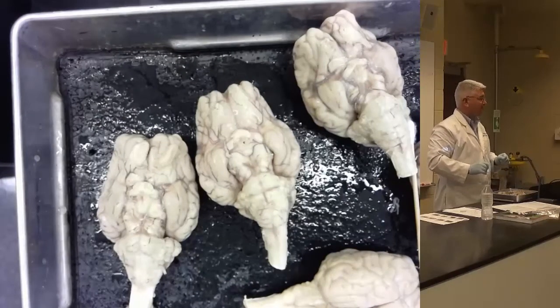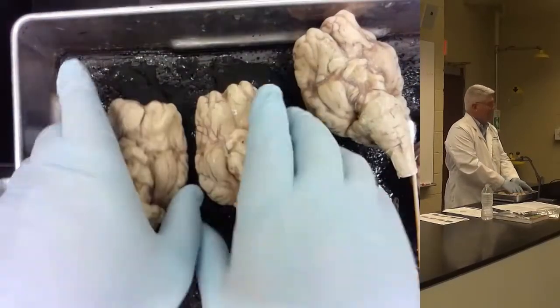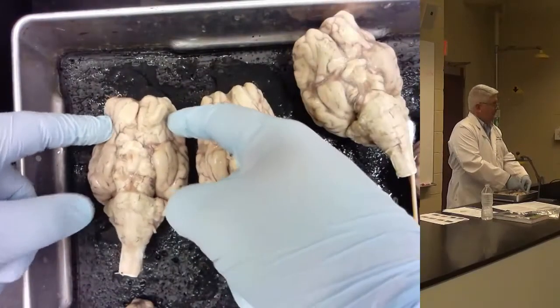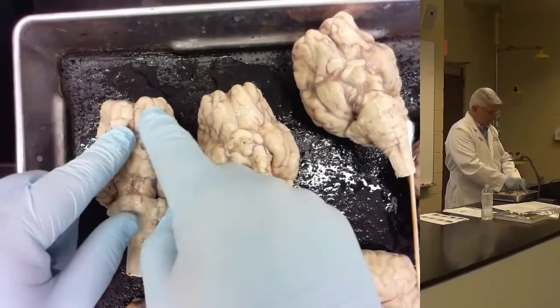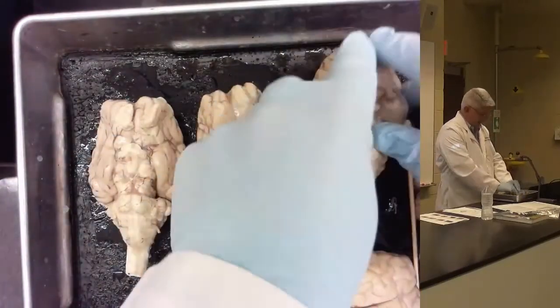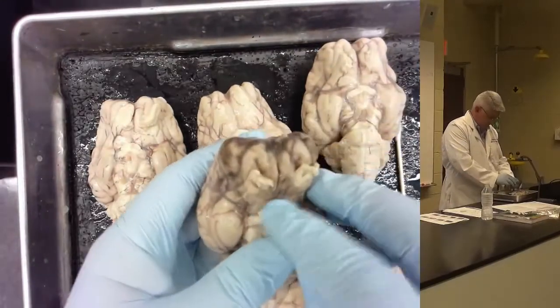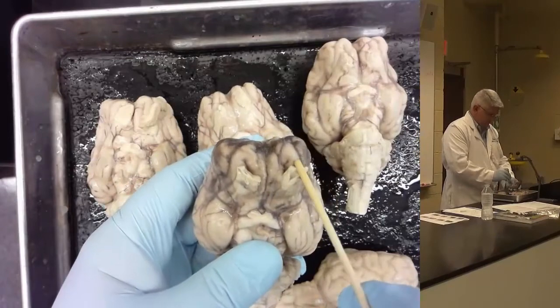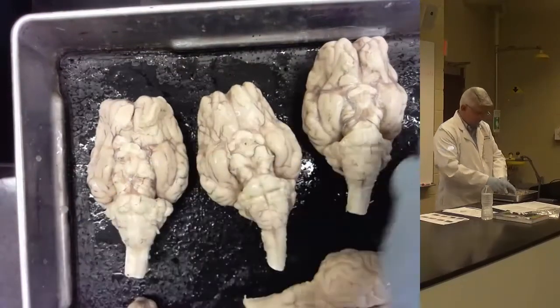Back. So the orbital is wider or more lateral. Yes, than they will be lateral in the orbits. Directly under the olfactory bulb, you have those two gyri that are on either side, even on these chewed up ones, right? That's either side of the longitudinal fissure. Orbital will be over here. Okay?